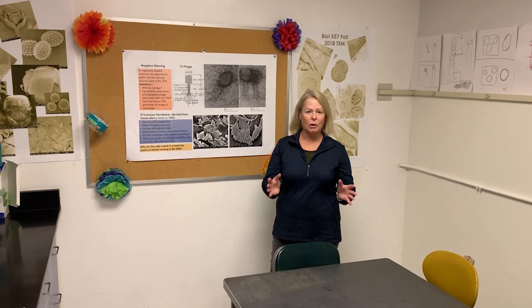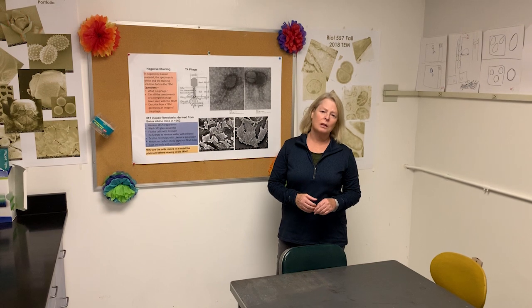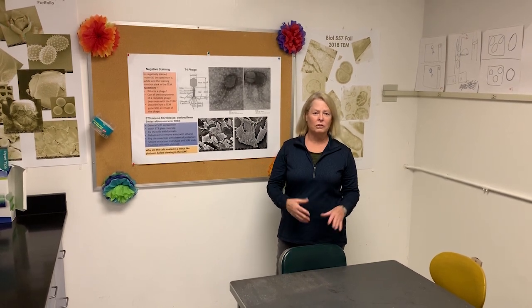BIOL366 class. In lieu of our usual taking you down here and showing you our instruments and having you do hands-on taking images, we've been forced to do this by video. So we're going to do the best we can. My name is Dr. Ingrid Niesman.